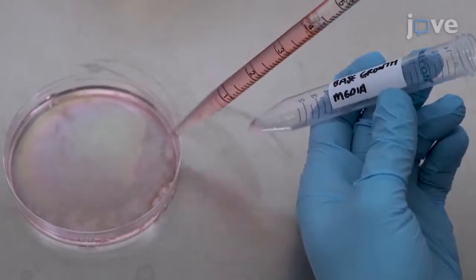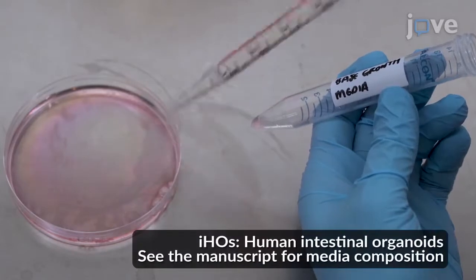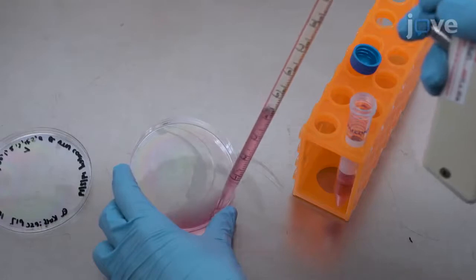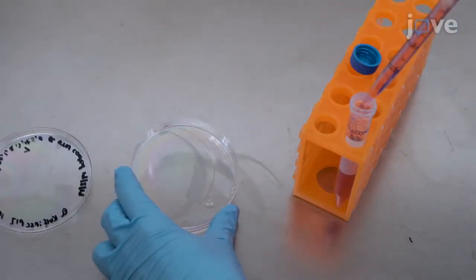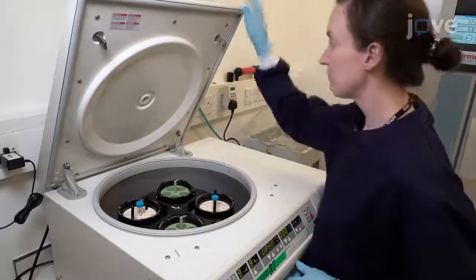Next, inactivate the collagenase by adding 5 ml of the organoid-based growth media to the plate. The hindgut cells should be floating at this point. Collect the hindgut suspension in a 15 ml conical tube. Then centrifuge at 240 × G for 1 minute.